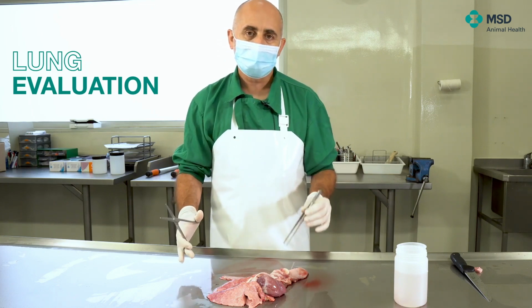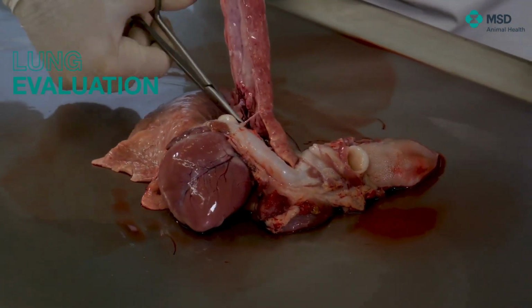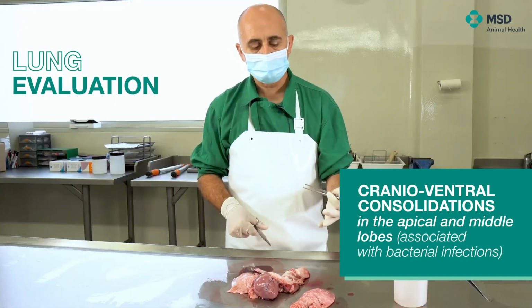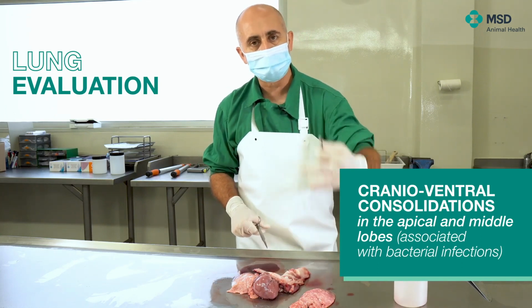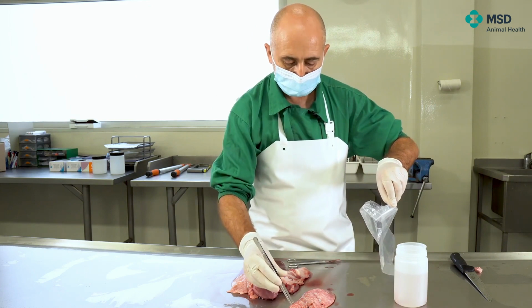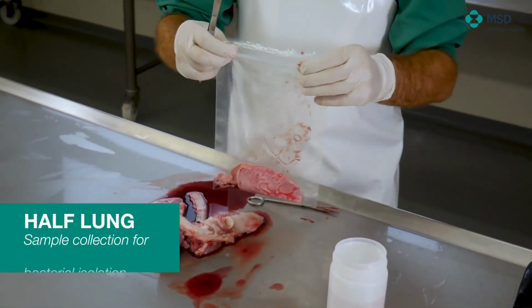However, in all cases, when we are talking about sample taking, we have to think about what we suspect. In our hands, what we prefer when it's a matter of bacterial isolation is to provide the whole hemilung to the microbiology department. So from this point of view, what we do is to take it as a whole, one lung. Of course, the one that presents the lesion, because it's very important for the microbiology department, when they receive the samples, to burn the corresponding surface, to open, and then to try to retrieve the corresponding bacteria.